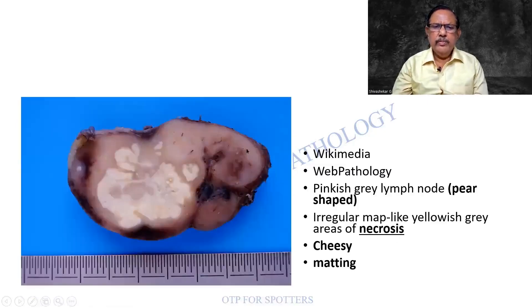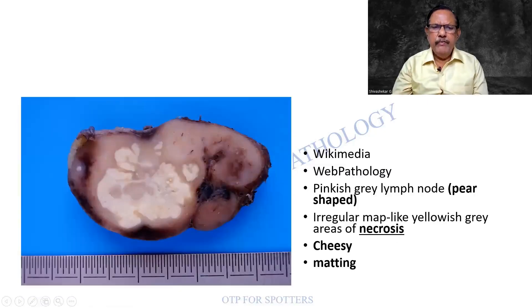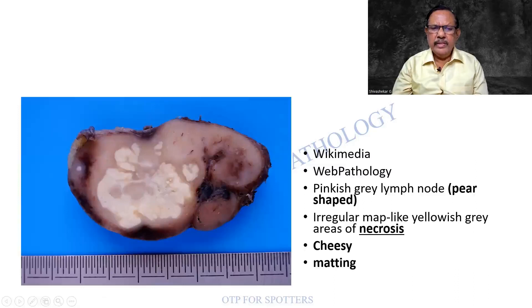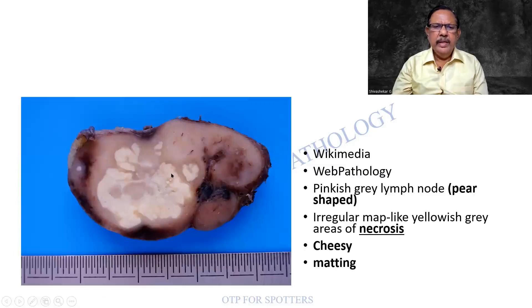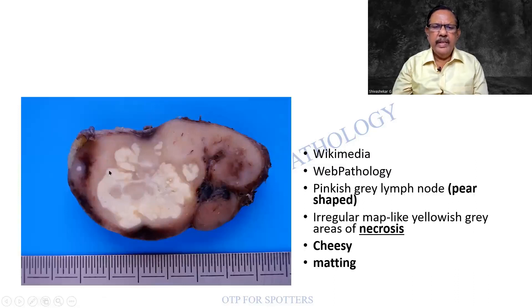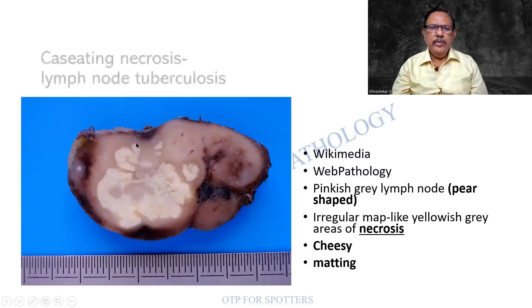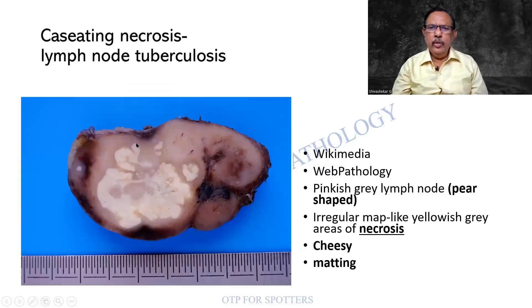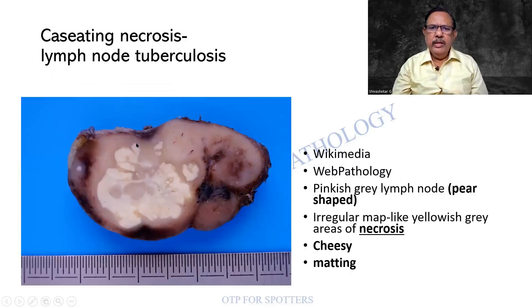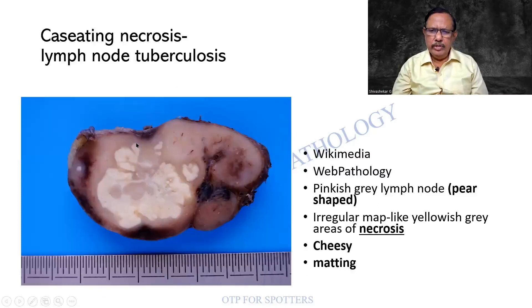This is a beautiful pear-shaped lymph node. There is another node that is adhering, and I find that there are cheesy materials. The diagnosis is caseating necrosis — lymph node tuberculosis.